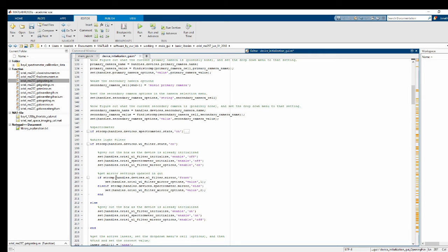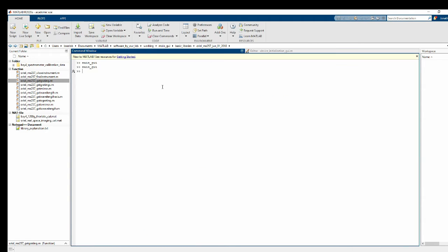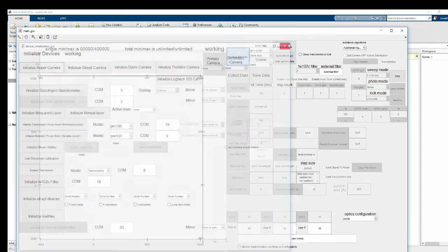Okay, this looks good. And if it's not already turned on, disable the mirror selection and turn on the initialization abilities. Okay, so let's try it out. Okay, this is on, this is off. Now this is on. I would like this to also gray out. And I think this is still wrong here, something's off here. So let's go fix that up.